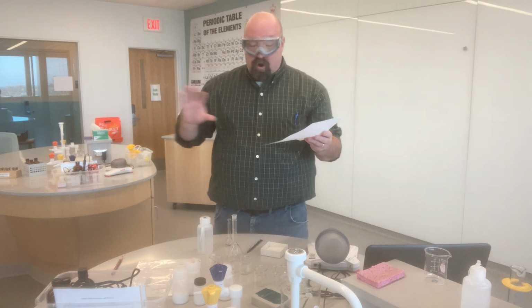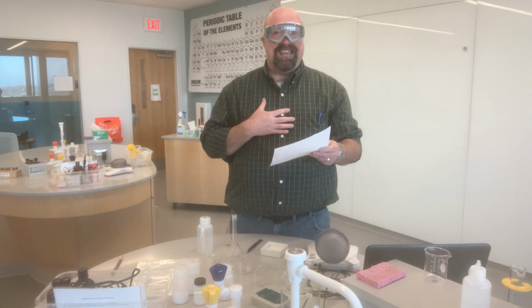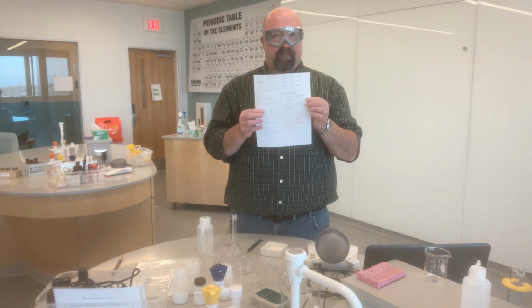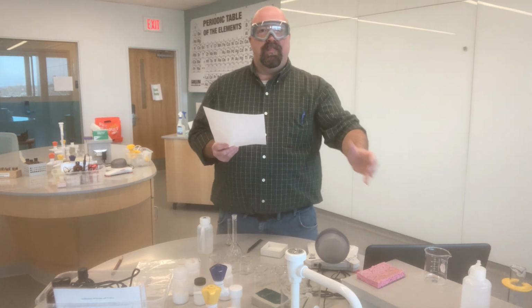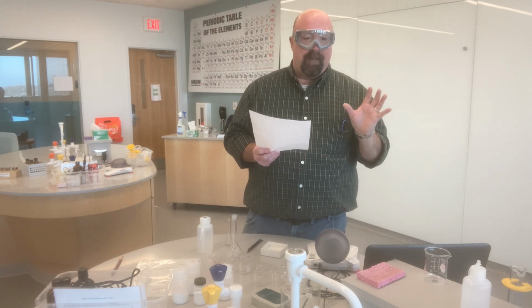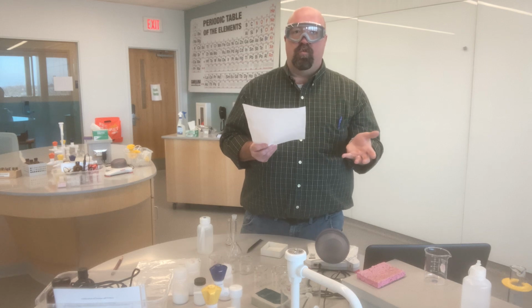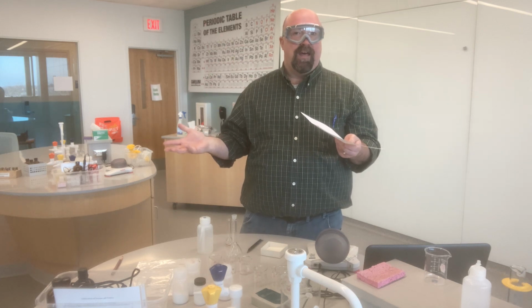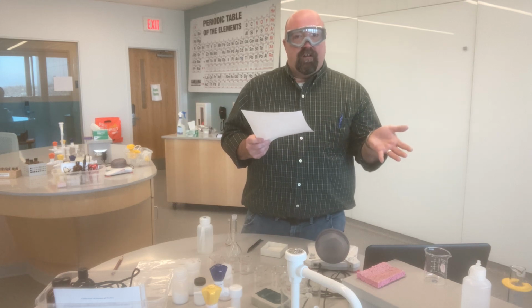You'll notice that I'm not going to be using the procedure from the lab manual today at all. Everything that I need in order to complete this lab today is right on this sheet. And so I just wanted to point that out to you, that this is a real thing, that those notebook templates, that pre-lab part, is something that scientists really do when they're getting ready to perform some sort of lab: they write out things that they are going to do within that lab and within that experiment. And so let's go ahead and get started.